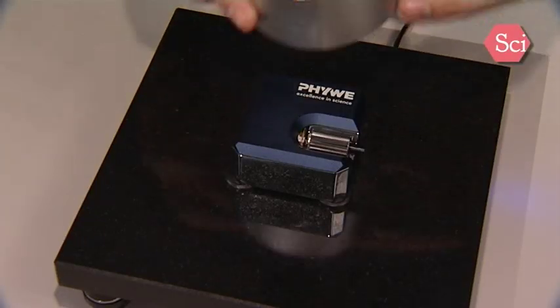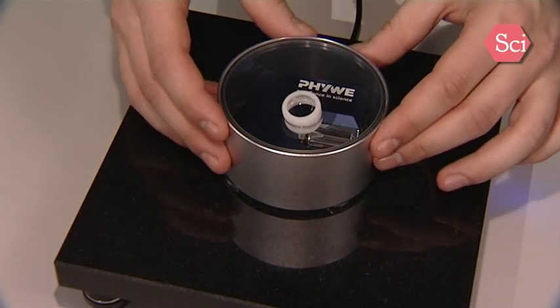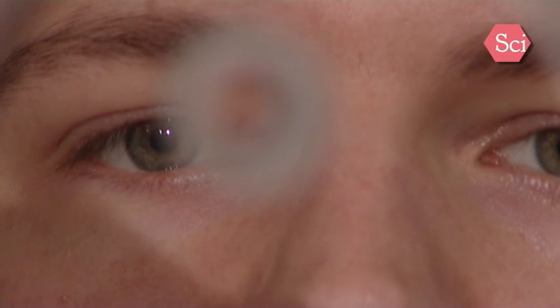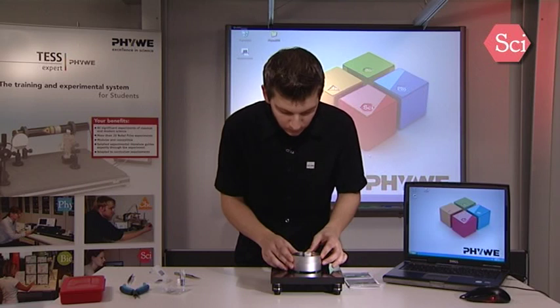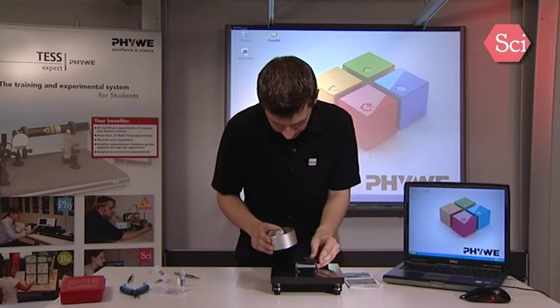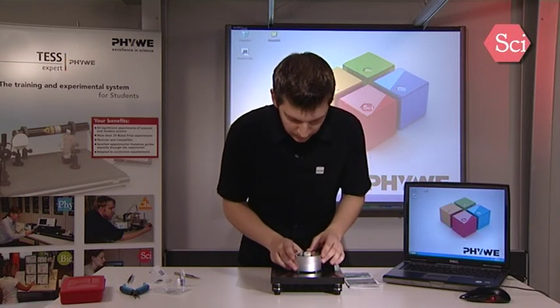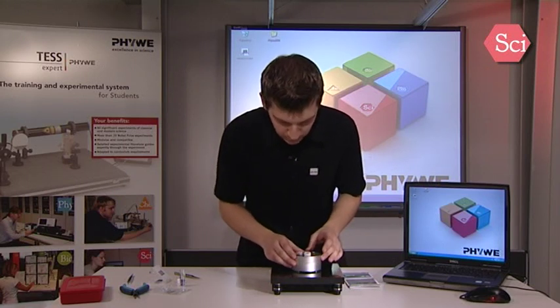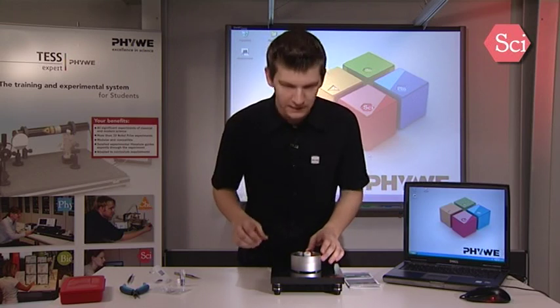It is very important that you only use a very small piece of wire, only about two millimeters long. Now we can use the cover glass with its magnifying lens to control the distance between the sample and the tip. I will push this a little bit further to the tip. We only have a very small distance between the sample and the tip — it's about a millimeter or below.